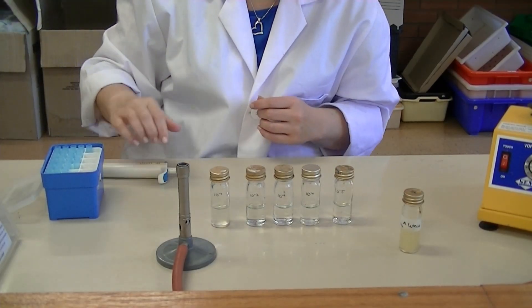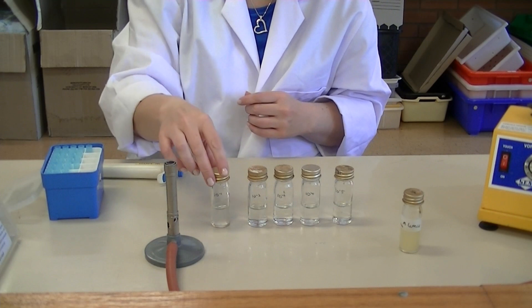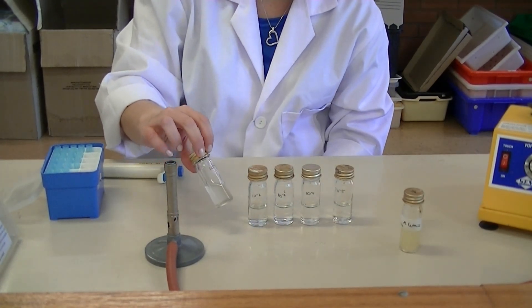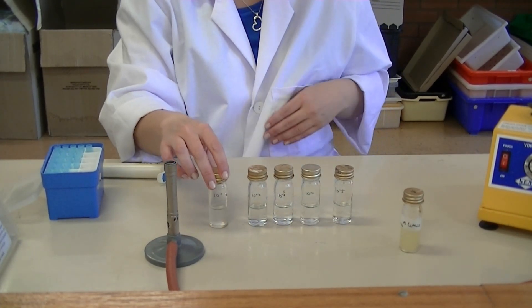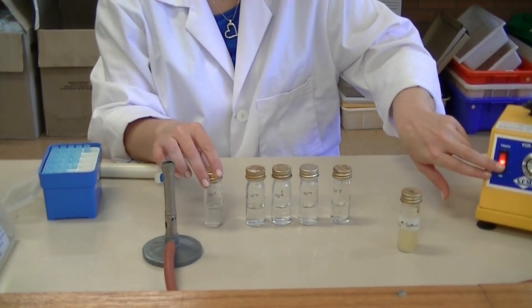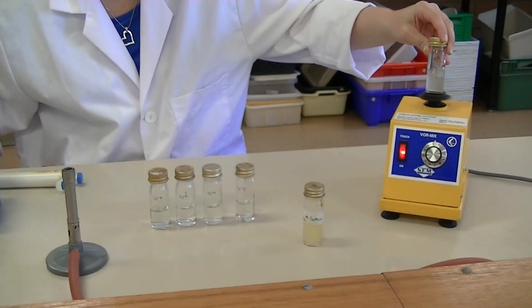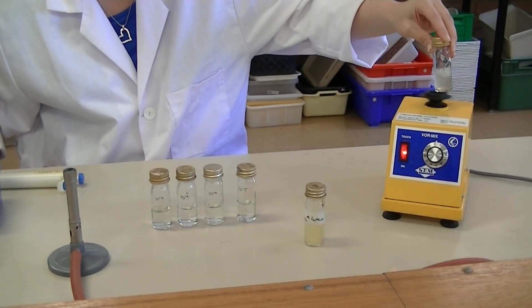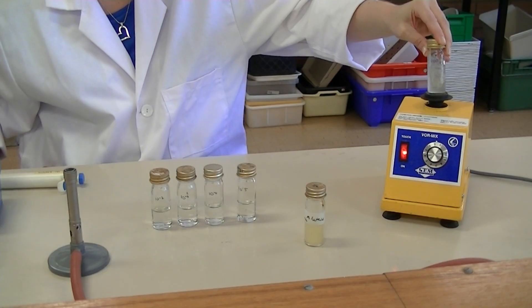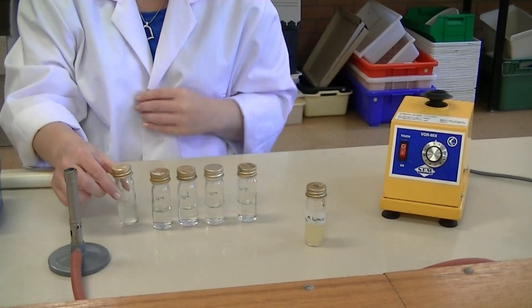Before doing the next dilution, make sure that the 10⁻¹ dilution is mixed properly. To do that, use the vortex — turn it on and hold the bottle in the vortex until the solution swirls around for a couple of seconds, and then it should be thoroughly mixed.